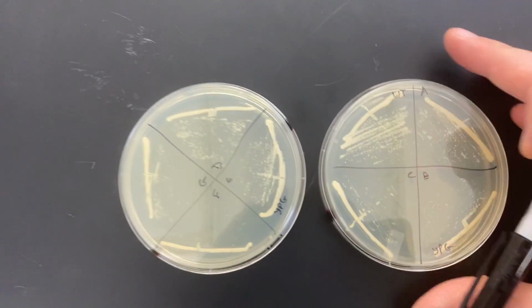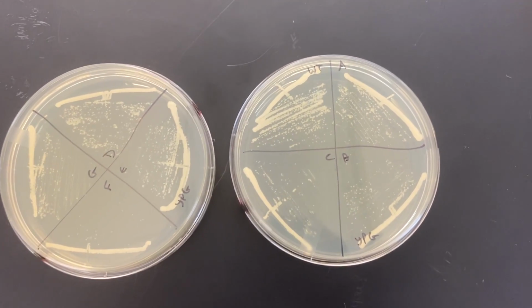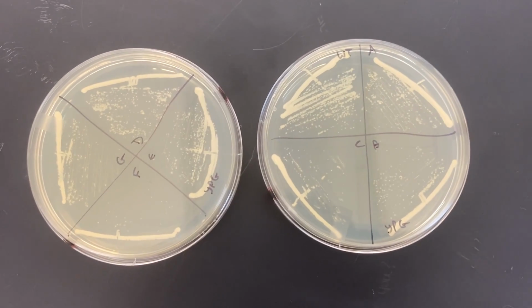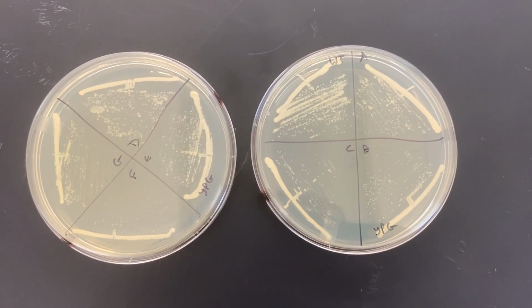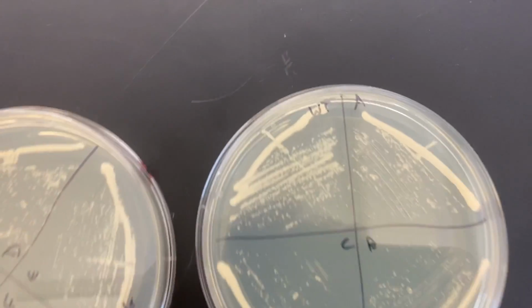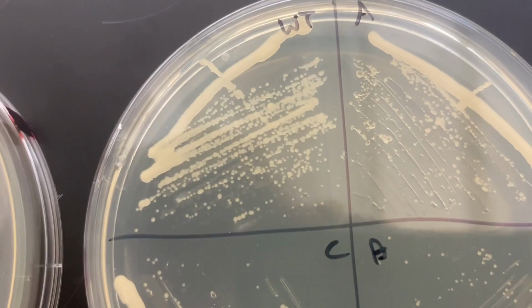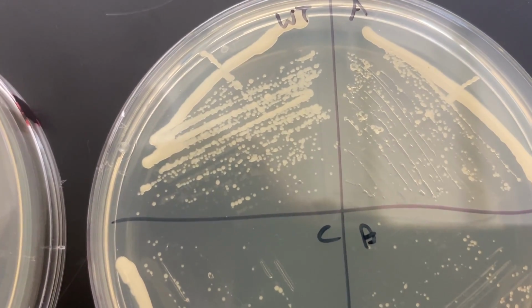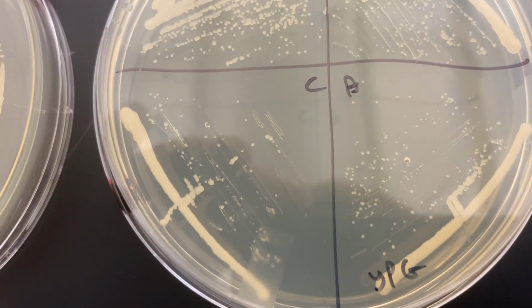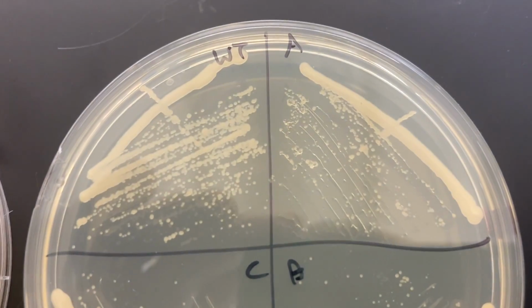These are the YP glycerol plates, and altogether there was a little bit more difficulty growing. I probably got these out of the incubator a little bit early. We could give them more time and see how big those colonies grow up. But at this stage we can more or less compare them. I'm a little bit surprised with how these turned out. They're different colony sizes, even though the colonies can be spaced equally. So there's a range of colony sizes, even for the wild type.